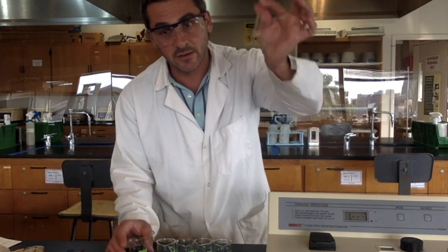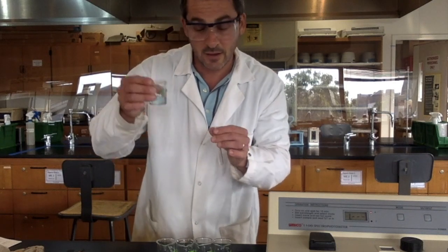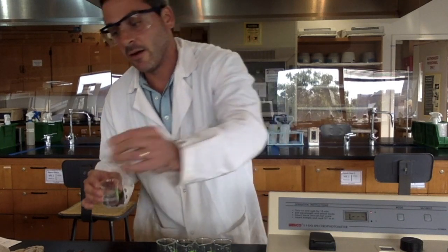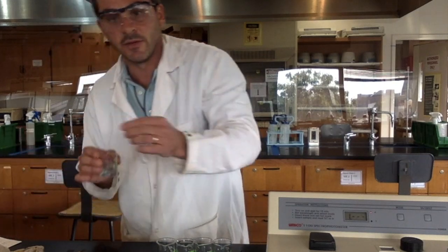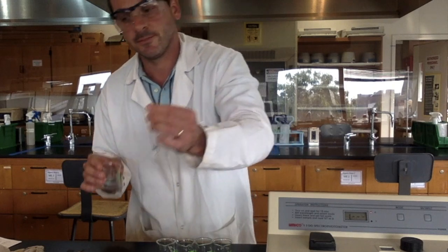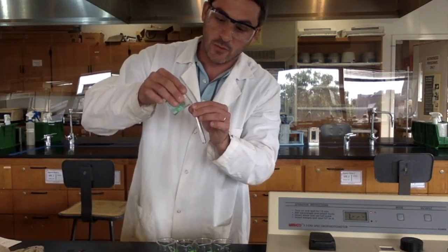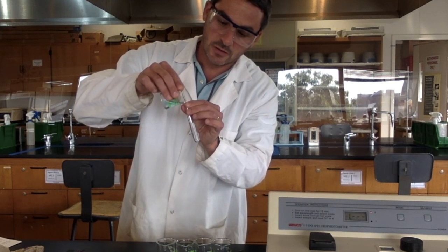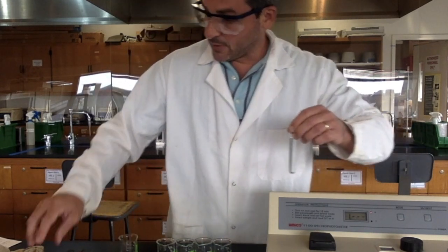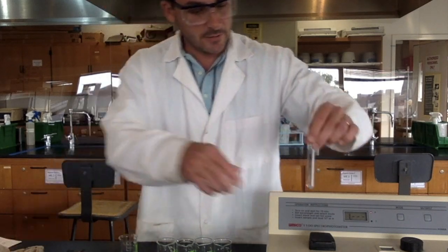So you can see there's still a little bit of water in here, right? I can't get all the water out, so I'm going to take a little bit of my solution and pour it in there and actually rinse out the cuvette with that. Just a little, and I'll do it 2 times. Alright, then I'm going to fill it with my solution. So this is E. And then I'll just clean it up again, make sure. Gotta be nice and shiny.